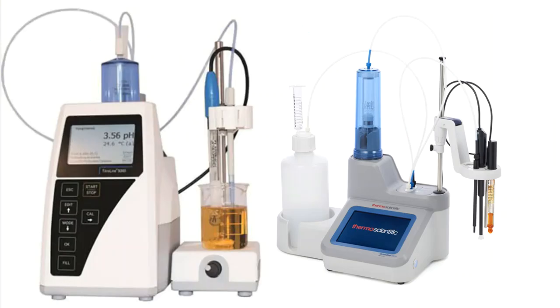So here's an example of two more manufacturer versions of automated titrators. Over here to the left, you're seeing that they have tried to simplify the actual pieces and compartments, with the display read here on the main component of the instrument. That's also where the titrant's going to be loaded up here at the very top. A few controls here at the bottom that you can touch and make some setting changes. And then finally, over here on the right-hand side, you're going to see a pH probe that gets dunked down into a solution in a beaker with a little stir plate and a magnet. And the burette tip, of course, is going to go in there as well.